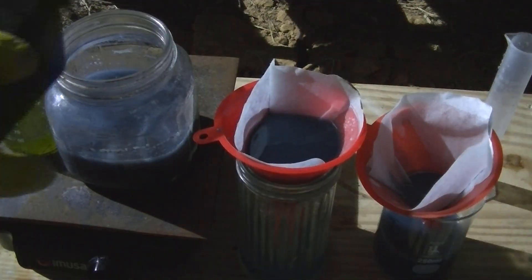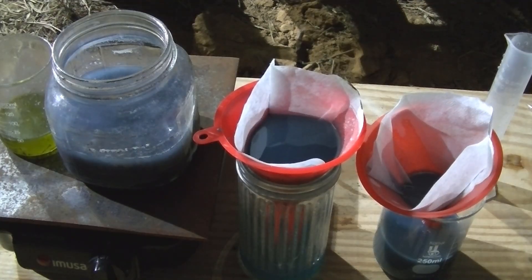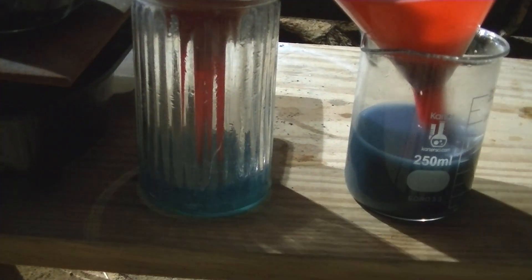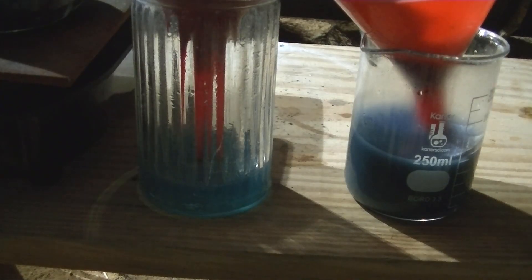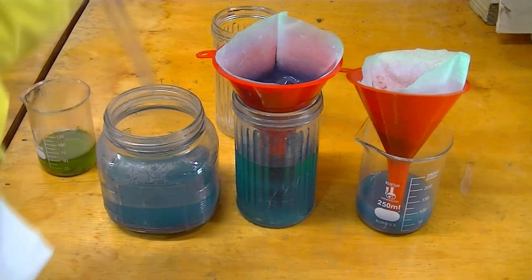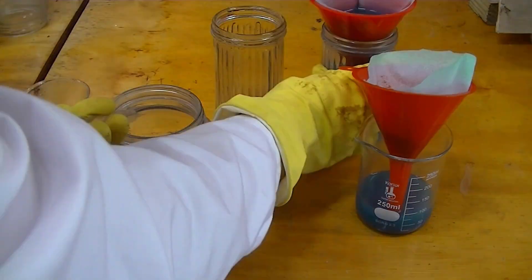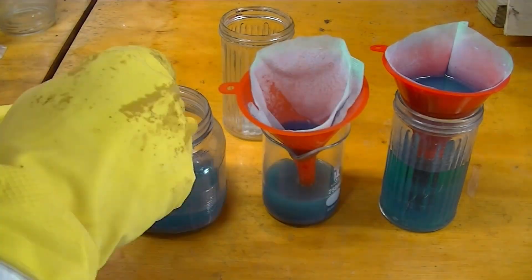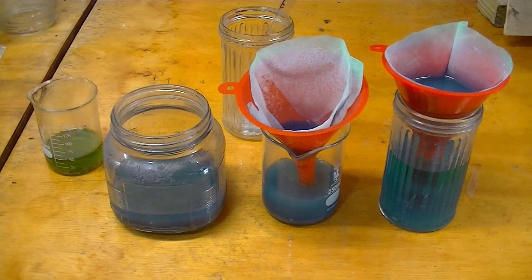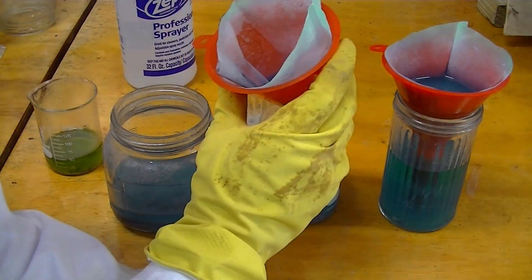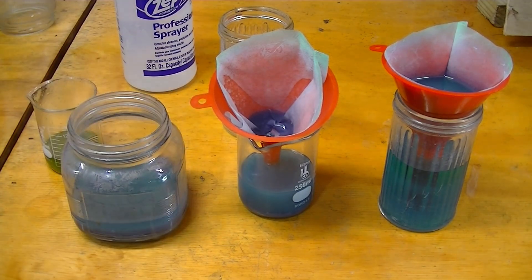Now, I had to add more water and more acid to finish dissolving the rest of the silver. This was the next morning, after giving it plenty of time to dissolve, it's time to filter out the rest of the solution.